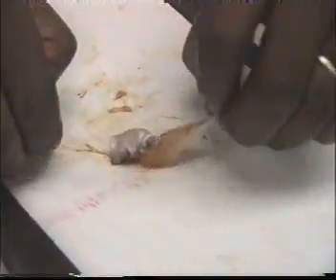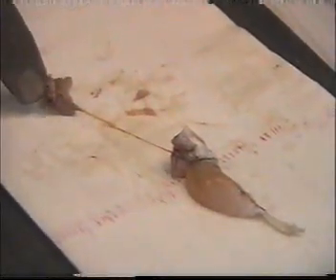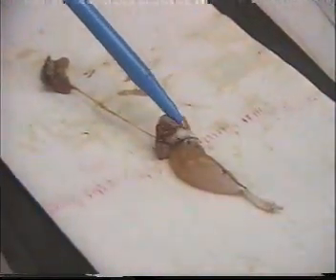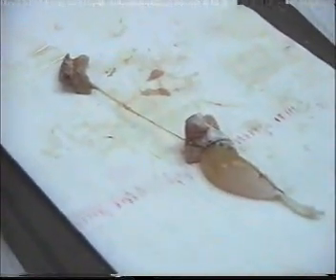So this is now our preparation. The sciatic nerve. This is the terminal part of the vertebral column. This is the gastrocnemius muscle. This is the Achilles tendon, and this is the knee joint. Usually we fix our preparation on the frog board at this point. We have to always keep our preparation wet with Ringer solution.